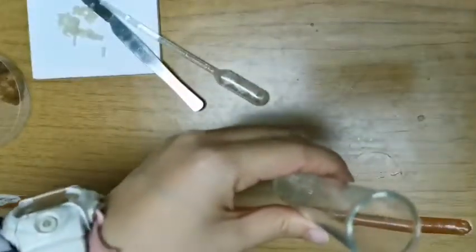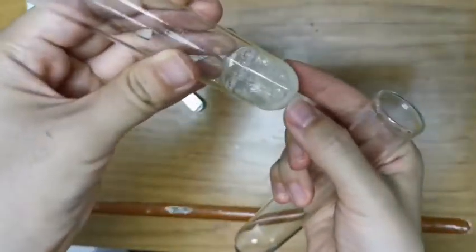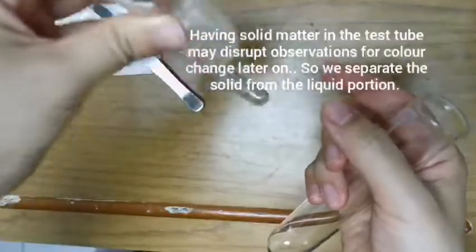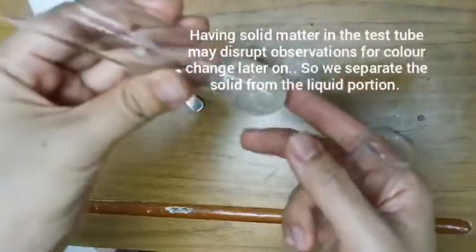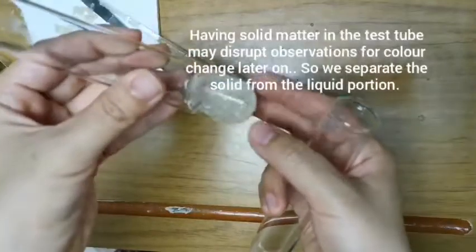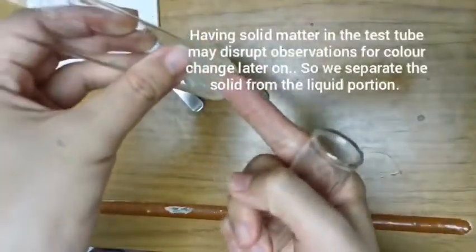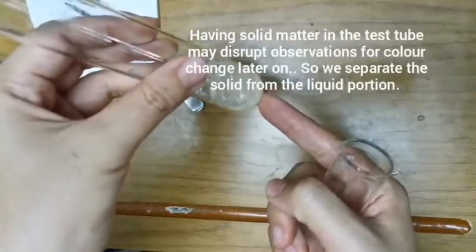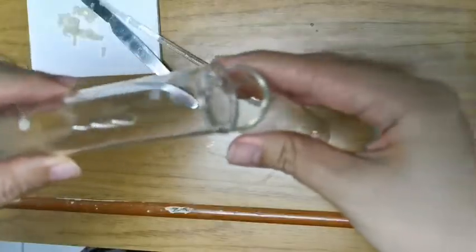Okay, next. What we realize here is we have some solution, but you also have a lot of solid food specimen at the bottom. We don't want the solid food specimen to get in the way of observation later on. So we want to separate the liquid portion from the solid portion. This is called decanting.